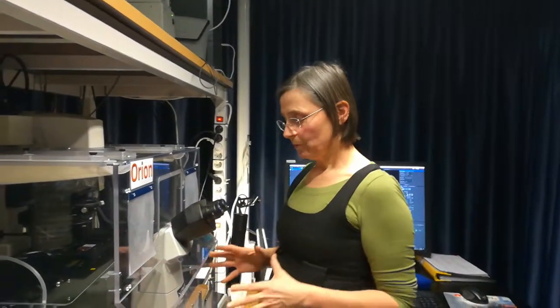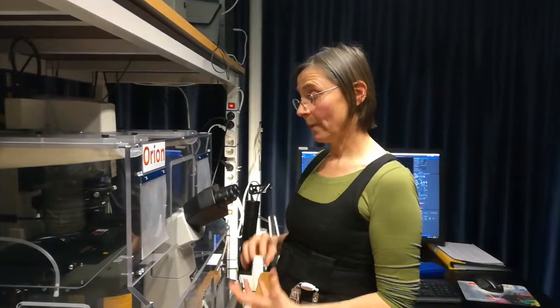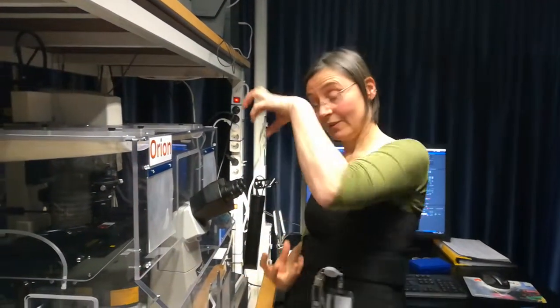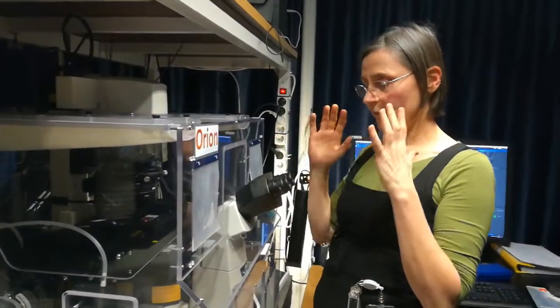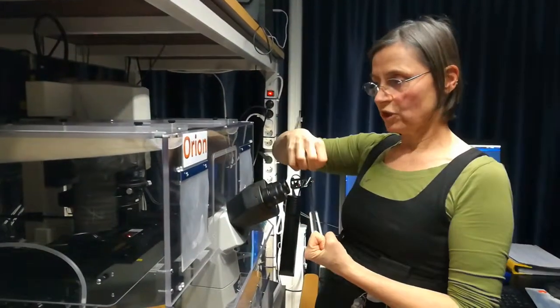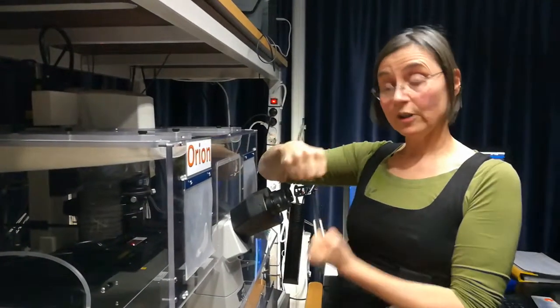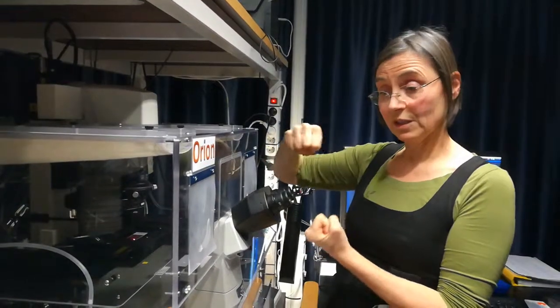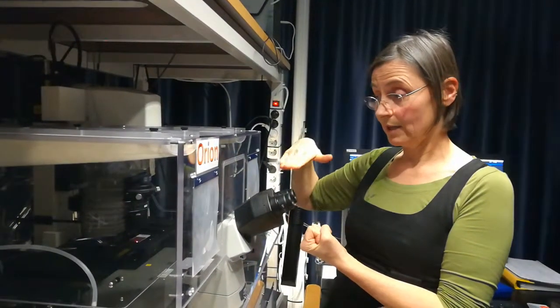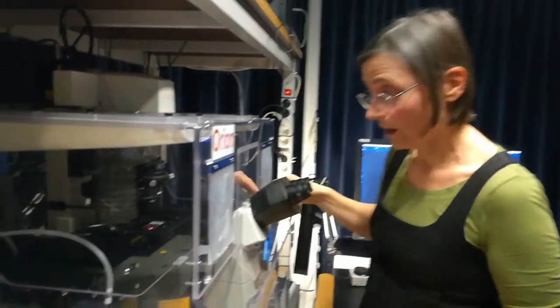So what do we do when we want to do Köhler illumination? The steps are exactly the same as for an upright microscope, but everything is upside down. Basically what we're going to do is match the focus of the condenser with the focus of the objective. The first thing we need to do is focus the objective. You need to have a sample on your stage — so now we have a sample.